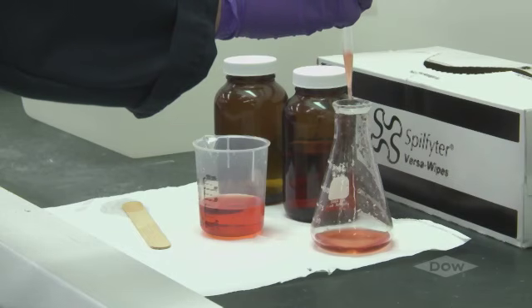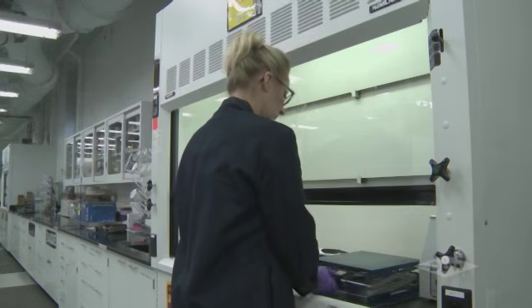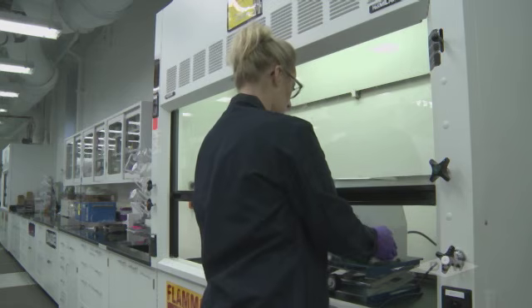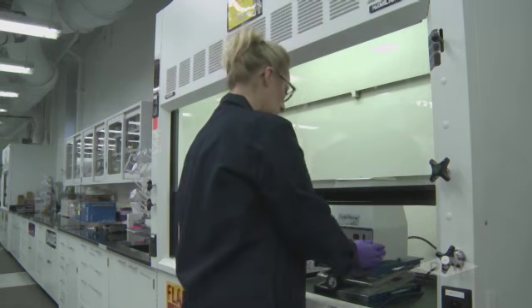As noted earlier, it's important that the fume hood is not blocked. Heather makes sure there's nothing crowding or blocking the baffles. She moves larger equipment to a stand or blocks. This allows air to move freely around and under the equipment. Otherwise, fume hood performance would be affected.